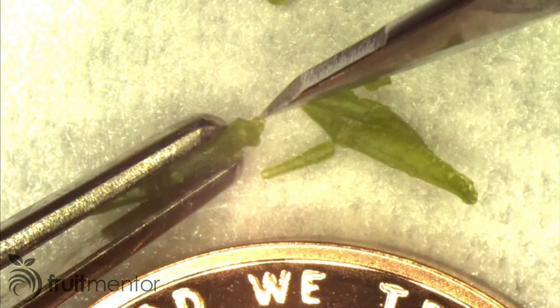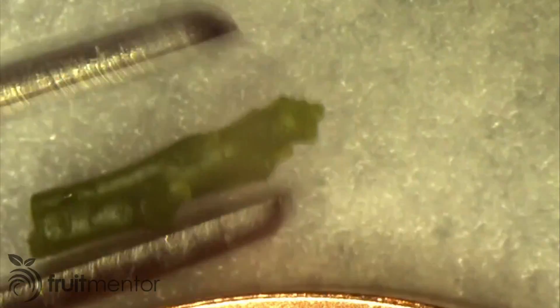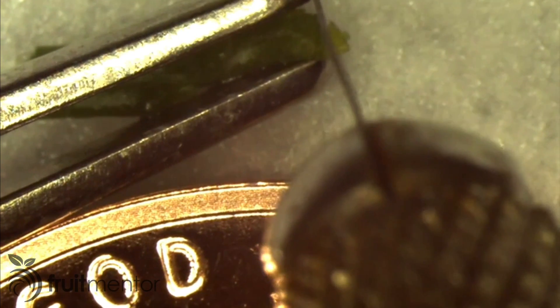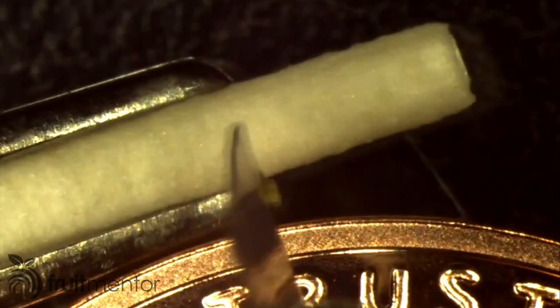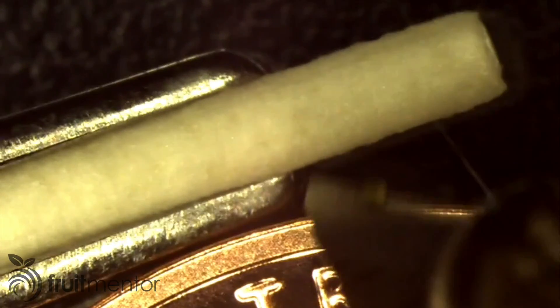The tiny leaves are removed with a scalpel and the apical meristem is cut off very carefully. Precision is critical. If too little of the shoot tip is removed, the graft will fail. If too much of the shoot tip is removed, it could contain diseased tissues.